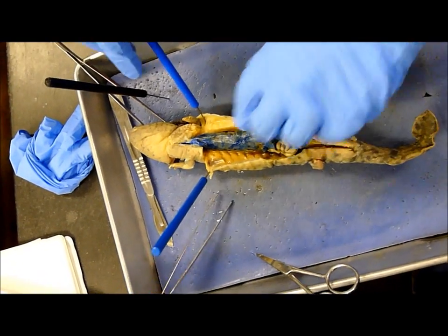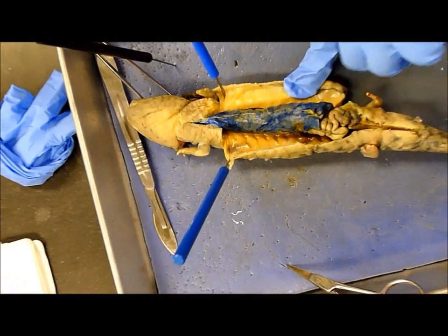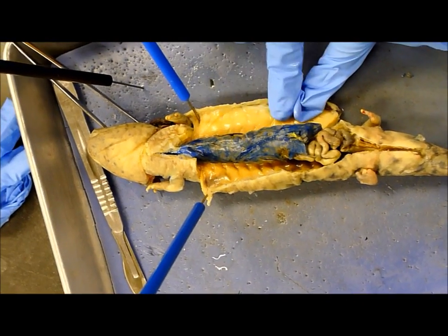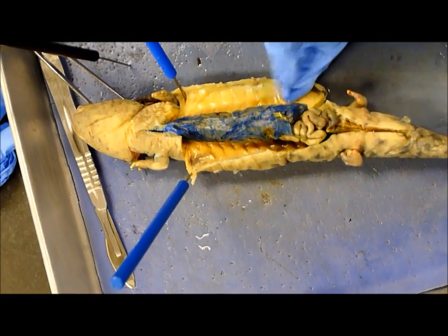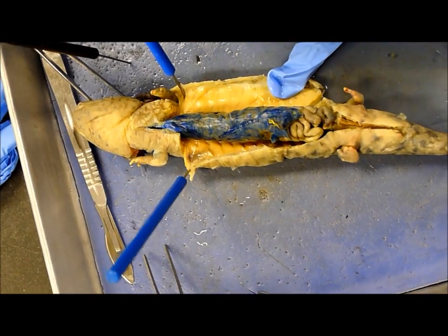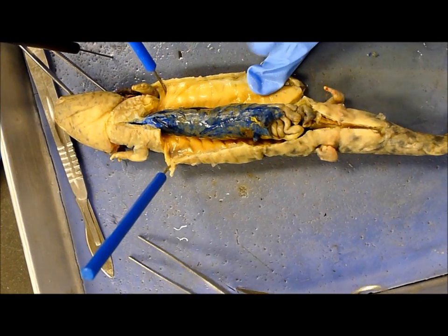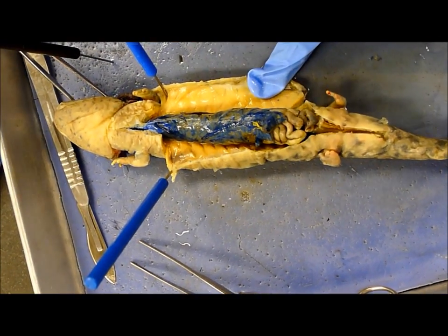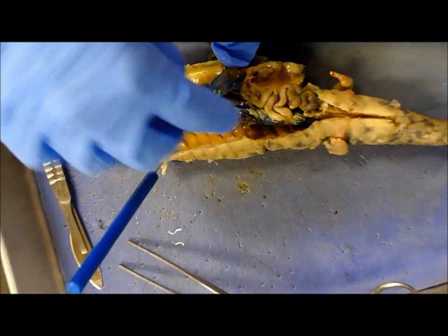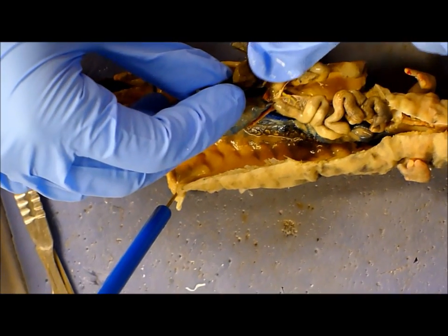So the whole region in here is the pleuroperitoneal cavity. This is the parietal serosa, and the visceral serosa surrounds the organs. This is the liver — the blue liver. The gallbladder is this little balloon-like sac attached to the liver right there.